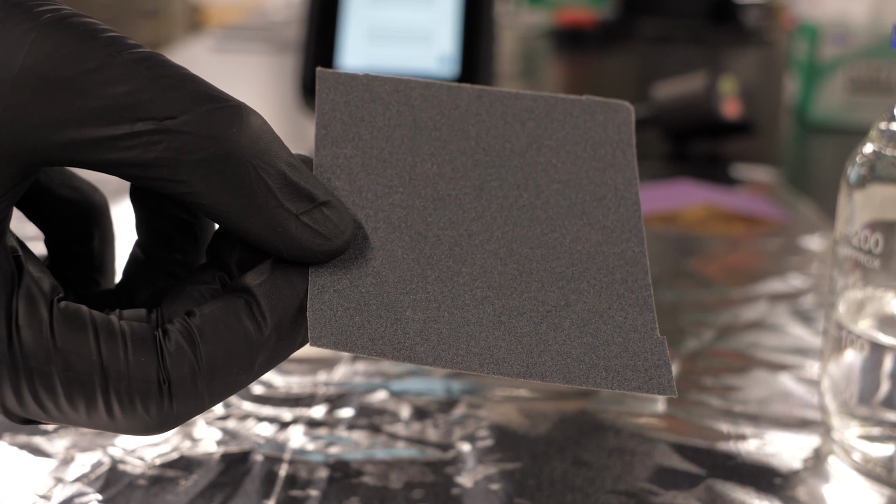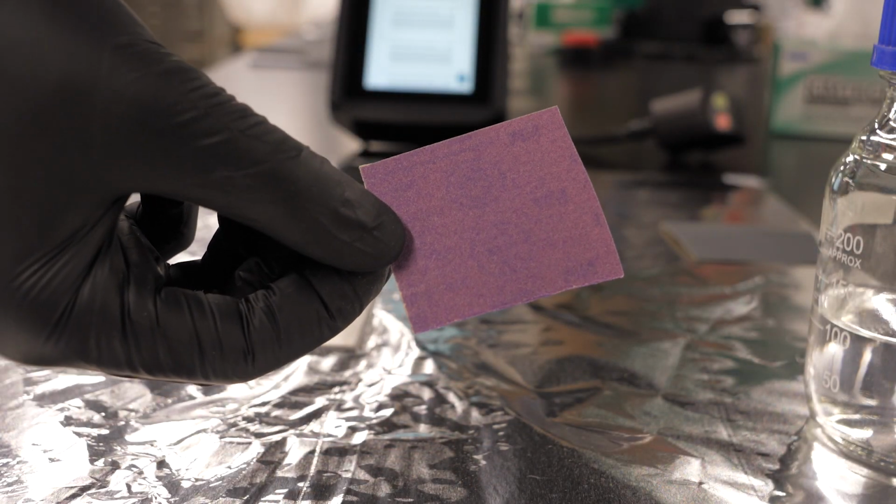This gray paper is clean. This purple paper uses a compound known as a stearate. Stearates are essentially a detergent that are used as an anti-clogging agent, which is great if you want to prevent the buildup of sanding debris, but pretty bad if you don't want something to transfer onto that surface, as evidenced by a 50-degree difference in our contact angle.